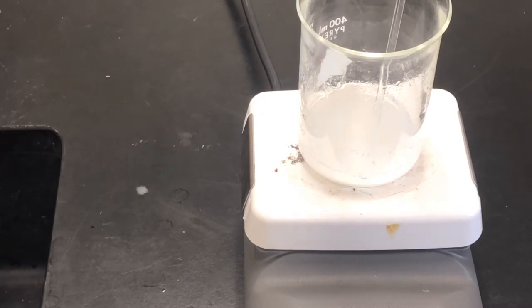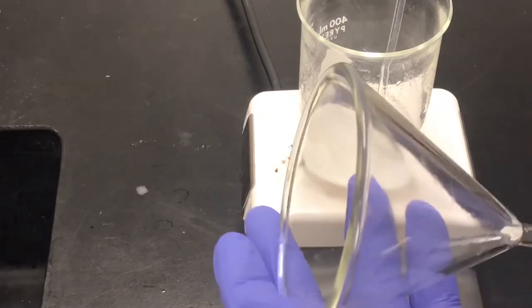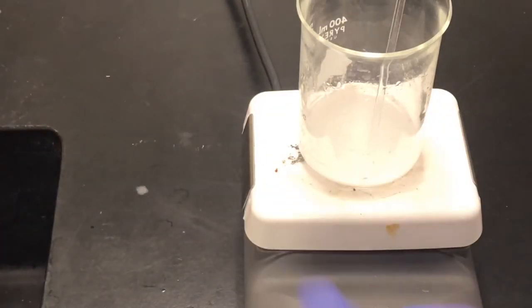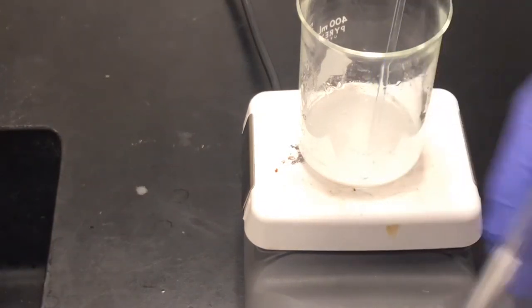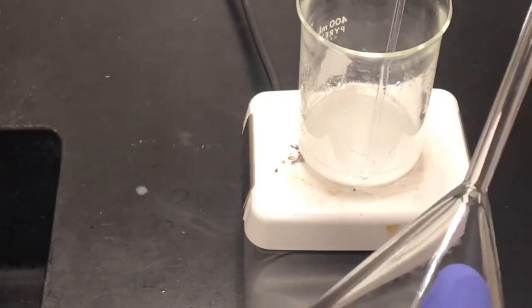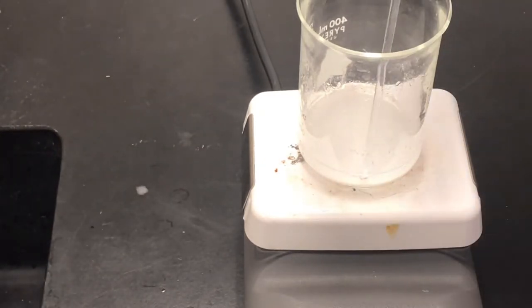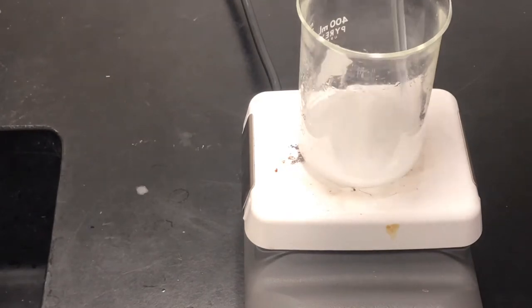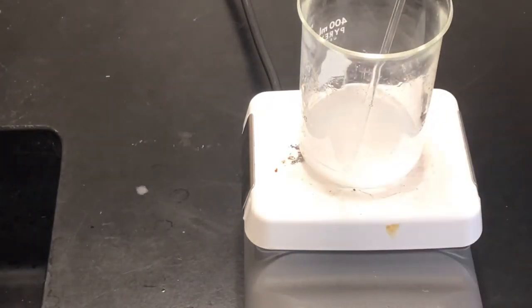So to improve this situation what we can do is possibly heat up, not hot but at least warm the glass, so that it does keep it warm as it is filtering. One way we can do that is on a separate hot plate we can just heat this up. We're not going to get it wet but we do want to just get it warm, not so hot that you cannot touch it. As this is heating up we would possibly try to do the same with this just to improve our results.